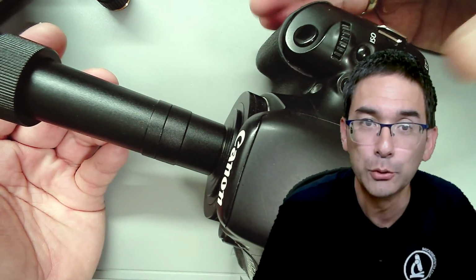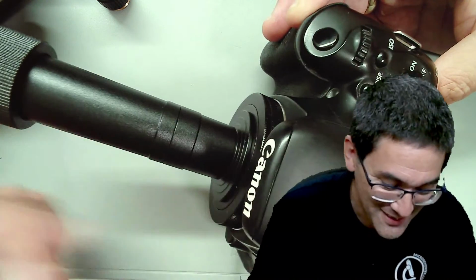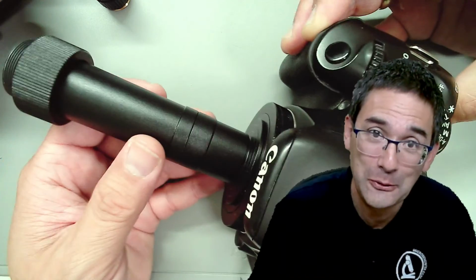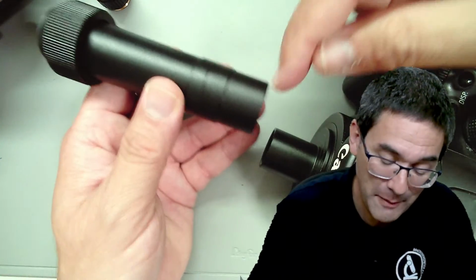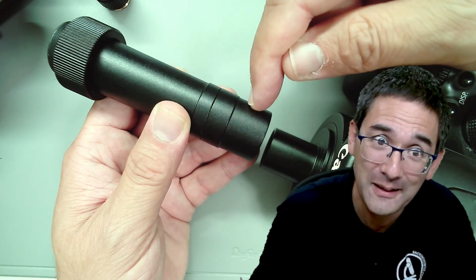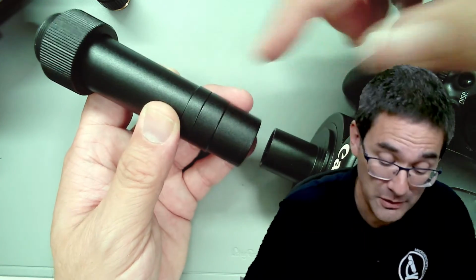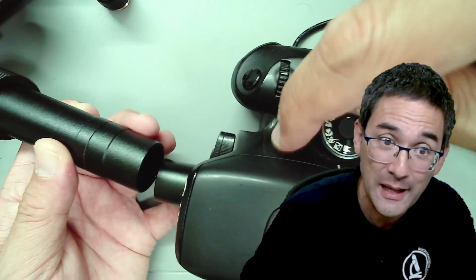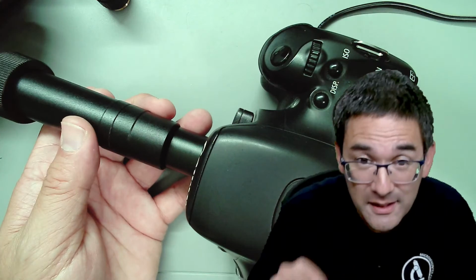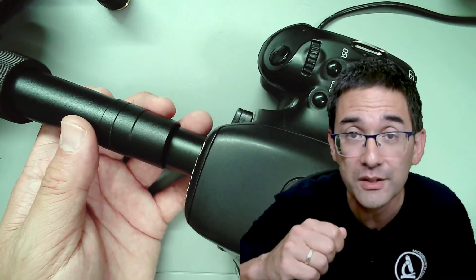If it's that easy, what's the problem? Well, massive problem, okay? This is not an ideal solution. Remember what I told you, that about 1 centimeter down here, this is where the image is created? This is where the sensor should be. No, the sensor is way inside the camera over here. So this basically means that when I look through the eyepieces and it's in focus, it's totally out of focus on the camera, and I have to refocus the microscope.